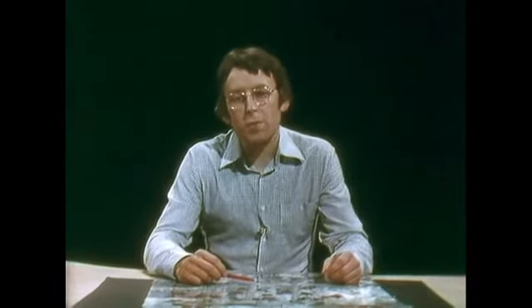So electron microscopy has shown that the pancreatic acinar cell, with its extensive rough endoplasmic reticulum, has a considerable synthetic capability. But if we want to know more about the movement and synthesis of enzymes within the cell, we need kinetic information. We need to be able to follow the movement of materials through the cell. And for this, we use a special technique called autoradiography.